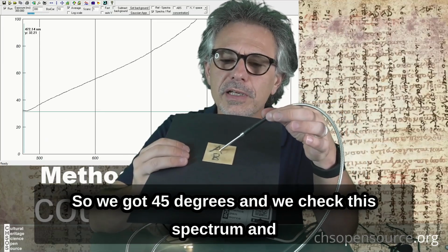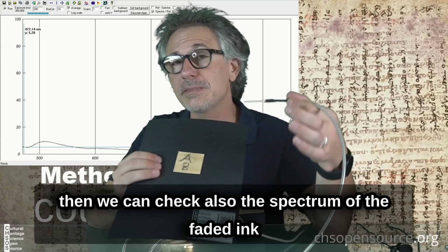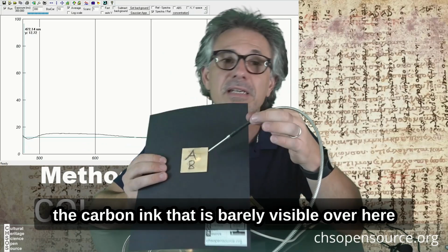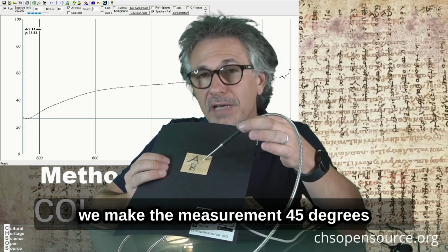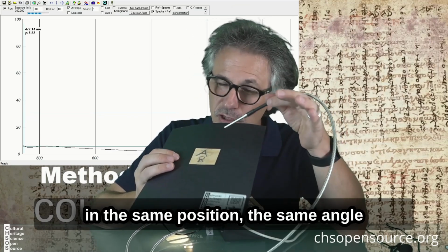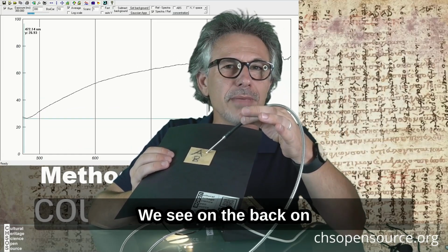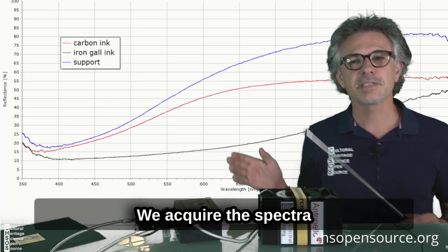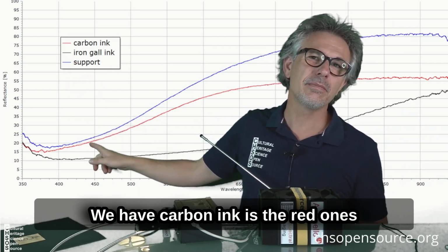So we got 45 degrees and we check this spectrum, and then we can check also the spectrum of the faded ink, the carbon ink that is barely visible over here. So we can go here and we make the measurement at 45 degrees. We need to have the probe always in the same position, the same angle. So we go here and there it is, we see on the back, on the spectrometer, the acquisition going on. We acquire the spectra, we look at the legend, we have carbon ink is the red ones.